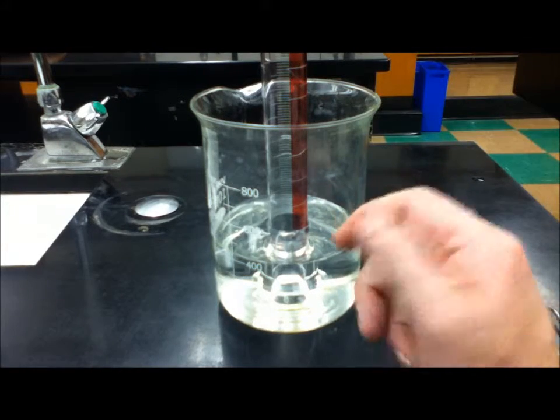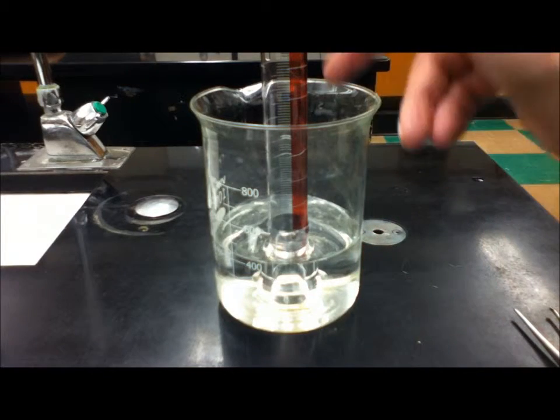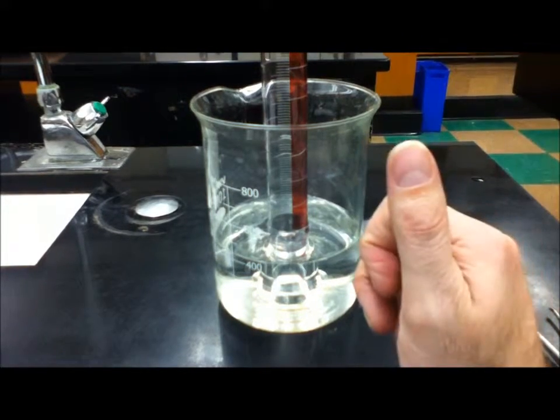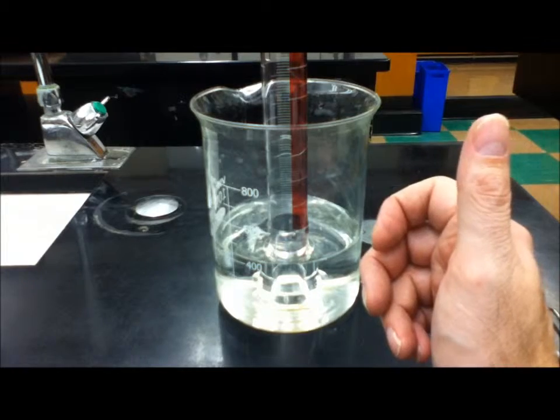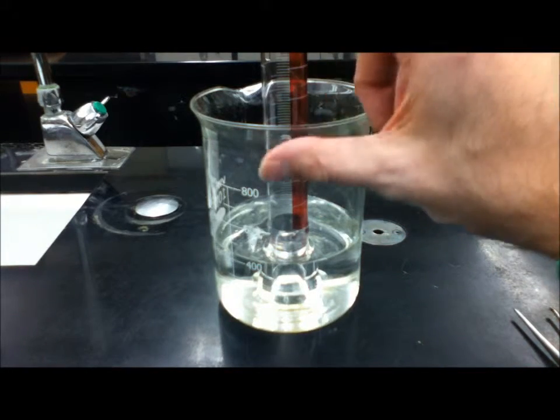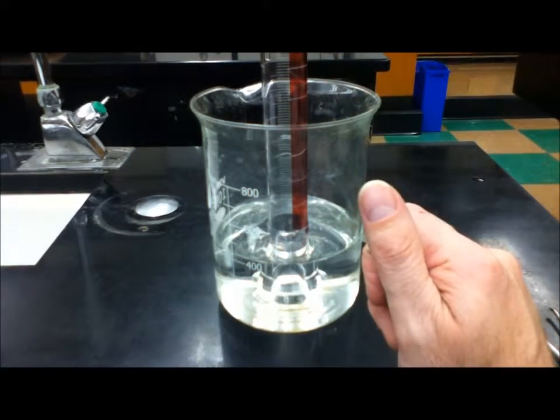Okay, so the idea is to encourage a reaction between oxygen that's trapped in the cylinder and the iron. We're basically going to rust the iron and hopefully reduce the volume of air here as the oxygen gets used up.